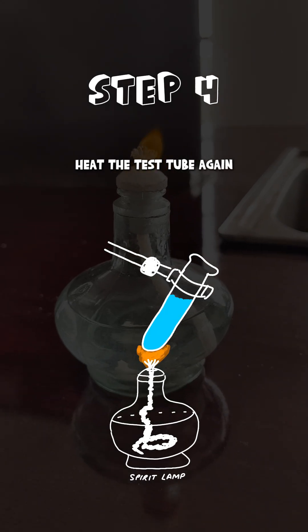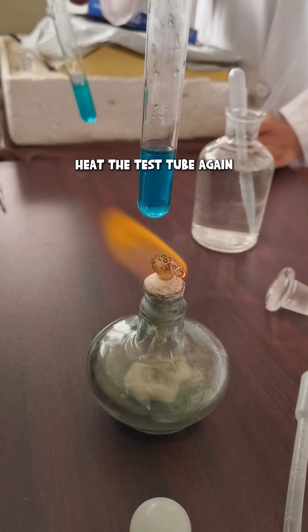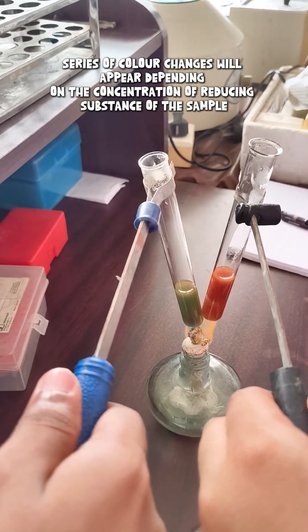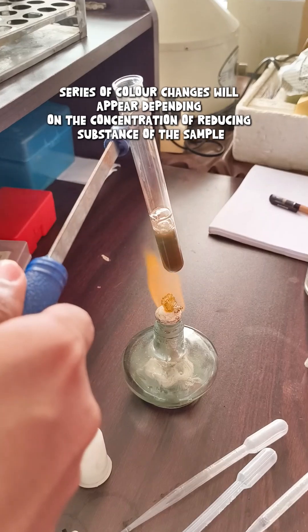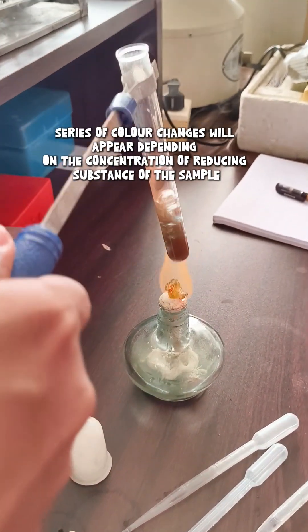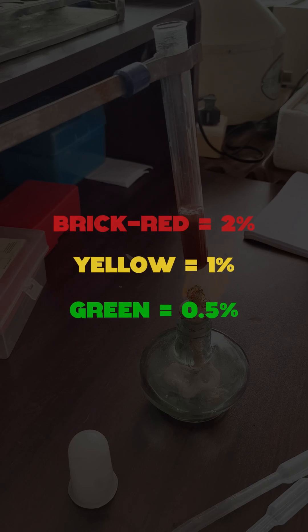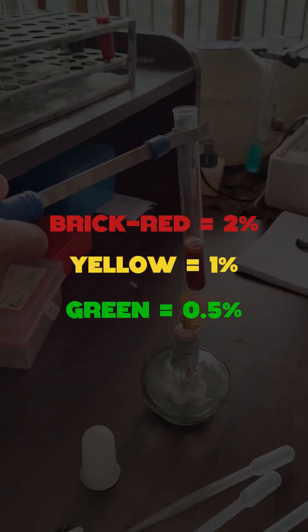Step 4: let's heat the test tube again. We can notice after heating the sample it shows certain colors. For instance, here we can see brick red color. These colors indicate different concentrations of glucose present in the urine.